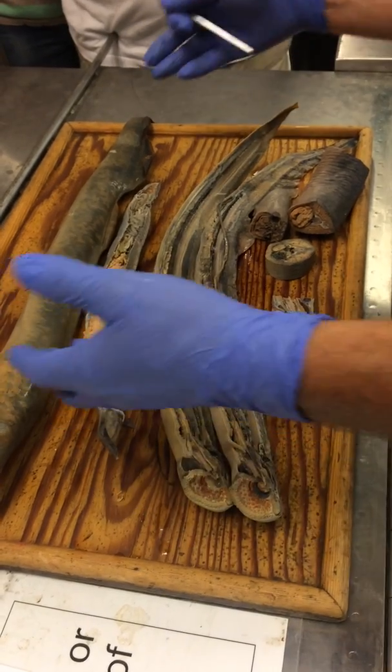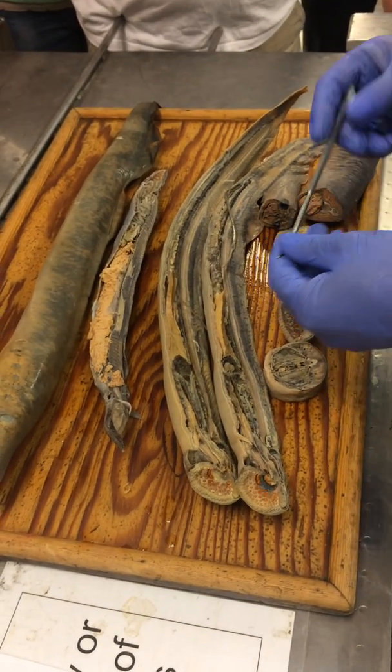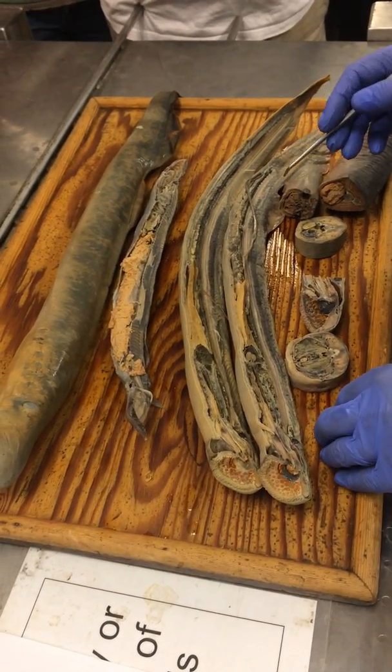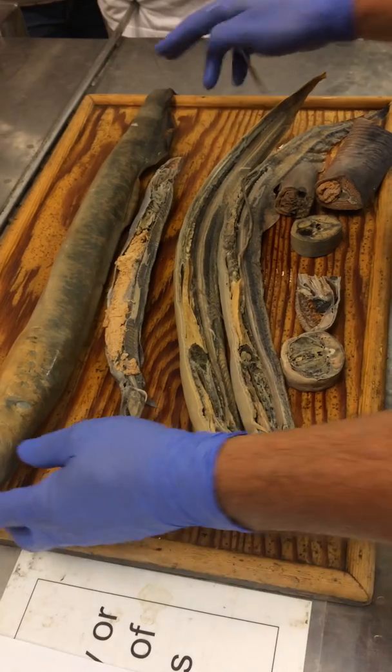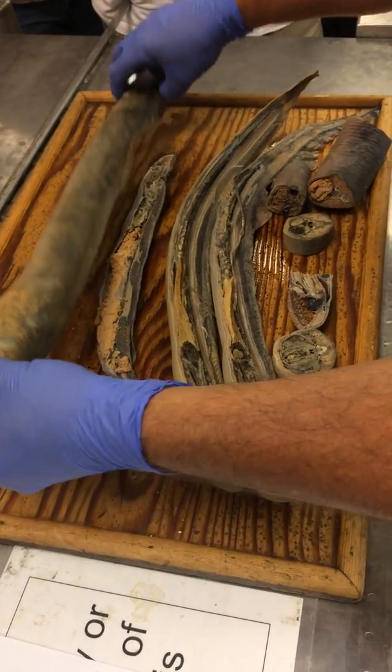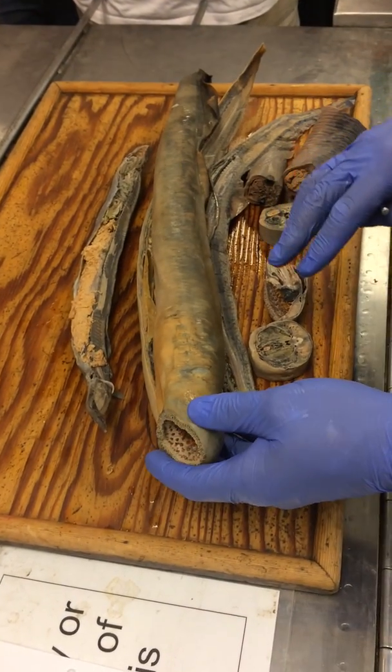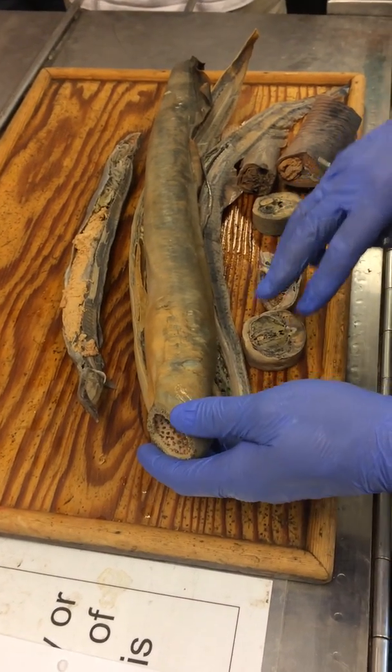So this is a lamprey. You kind of got that already. I'm going to try to go kind of quickly through some things that I think were kind of non-problematic.